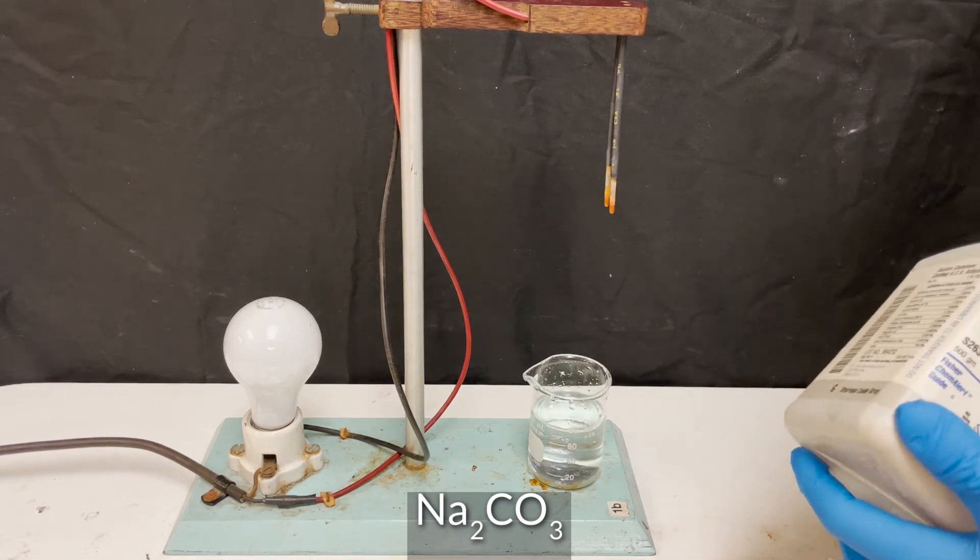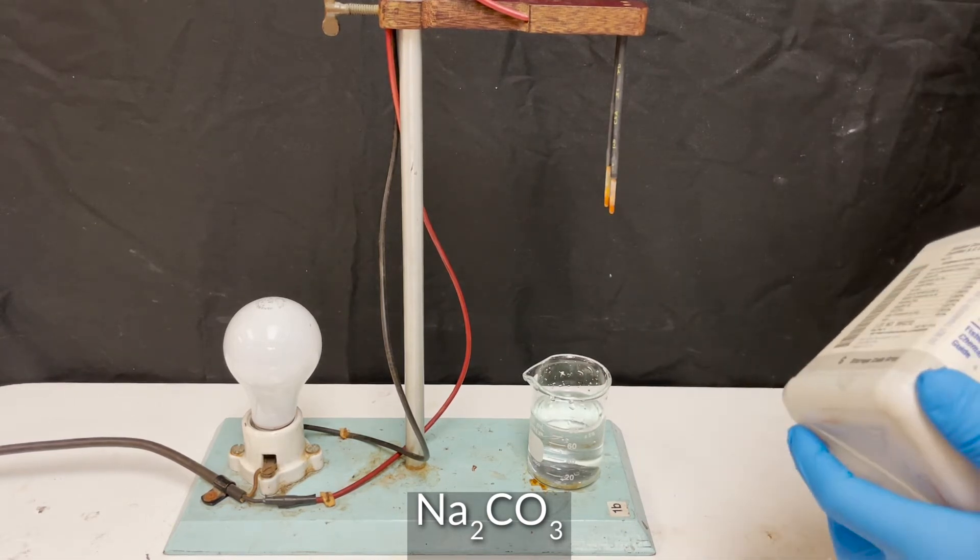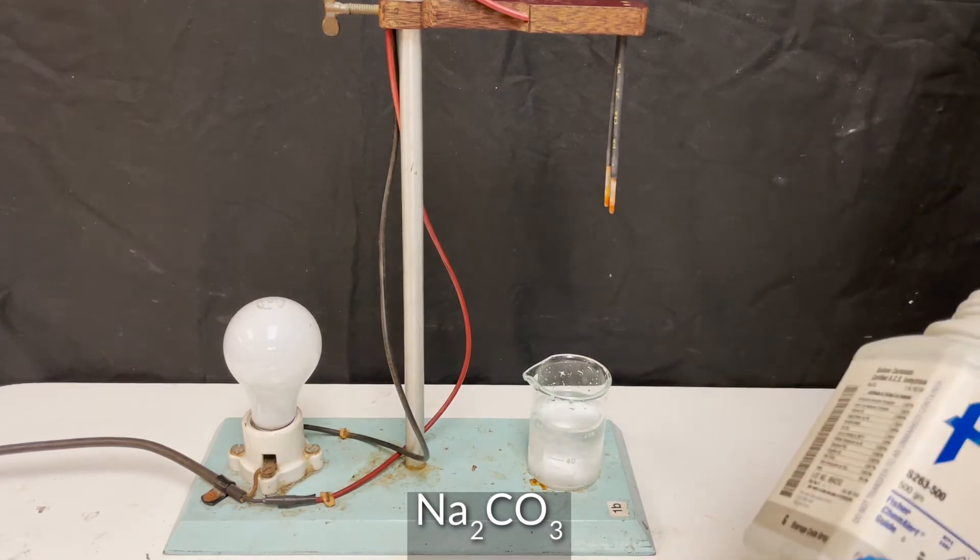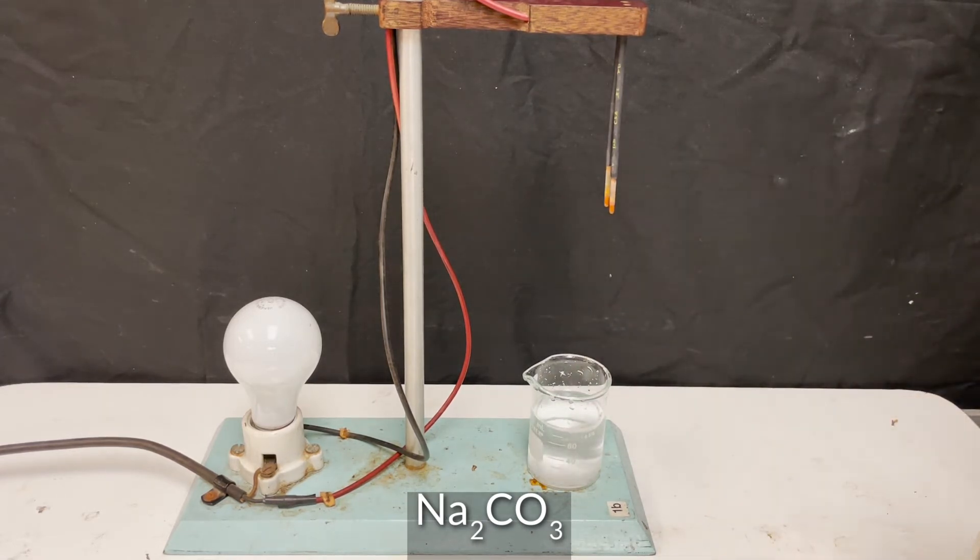The last compound that I'm using is sodium carbonate. Solubility rules predict that carbonates should be insoluble in water, but sodium carbonate is an exception.